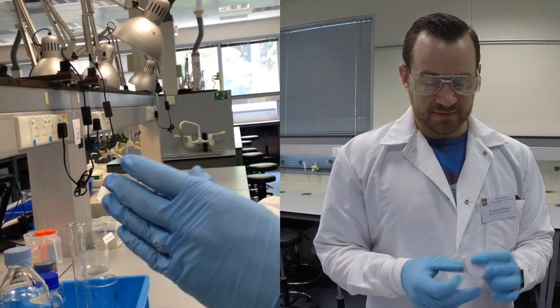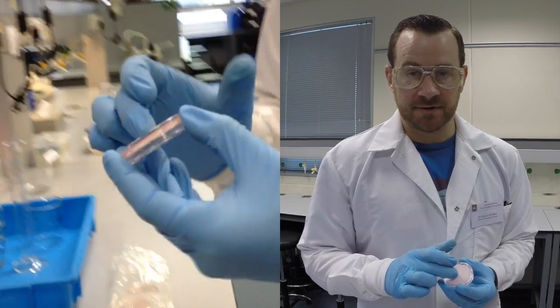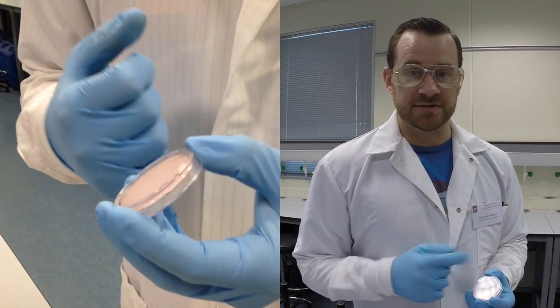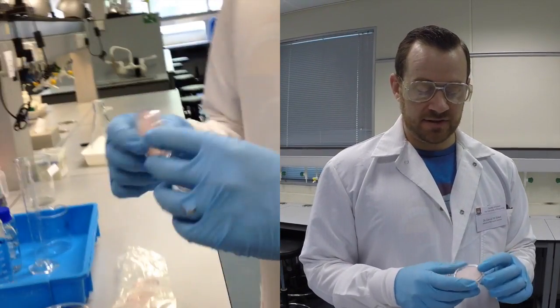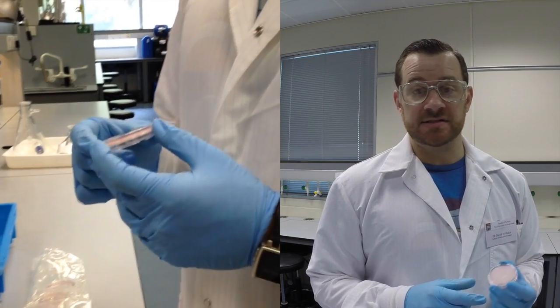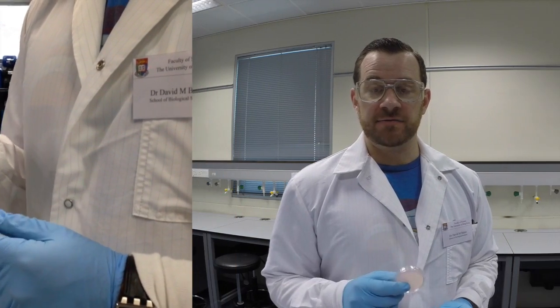So now that I have the membrane on here, you can see it's not coming out. I can put the lid back on my plate, and then I'm going to label my plate and make sure it has my group number, the sample identification, and the dilution factor that I used. Did I filter 1, 5, or 100 milliliters through this membrane? So please keep track of all that information on your plates. And you can store these plates here in the classroom, and we will be taking them to an incubator to warm up to 37 degrees Celsius for 24 hours. So one member of your group will need to come back in 24 hours to check on these plates and provide a count of the number of colonies that you see.